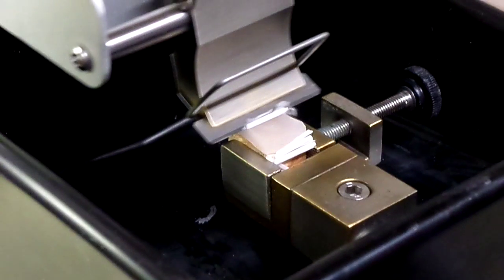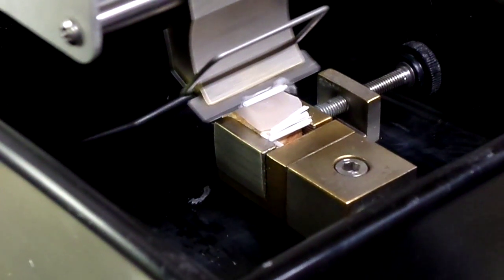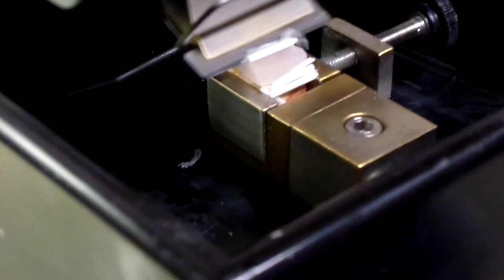I'll go ahead and make another cut just like the last one, so you can see that it's cutting consistently. It is indeed lifting the specimen the correct amount and it is vibrating just the way it's supposed to.